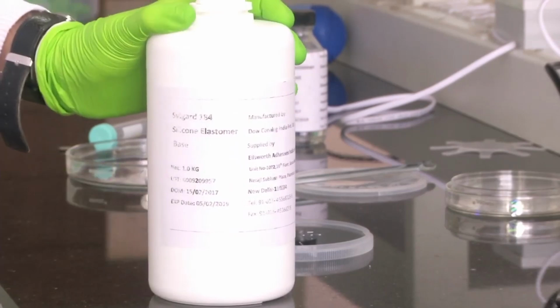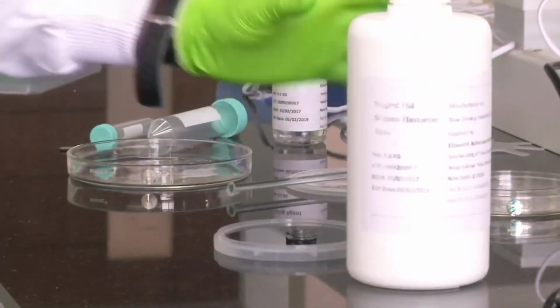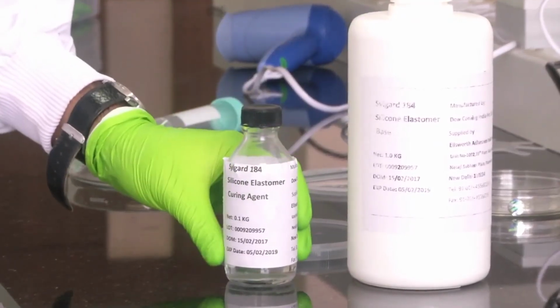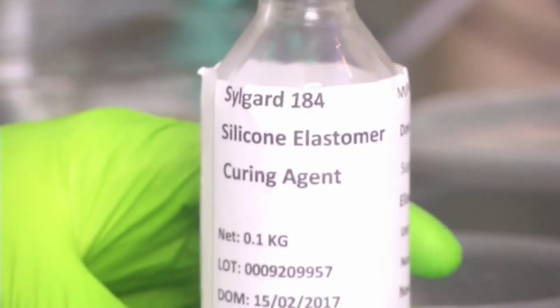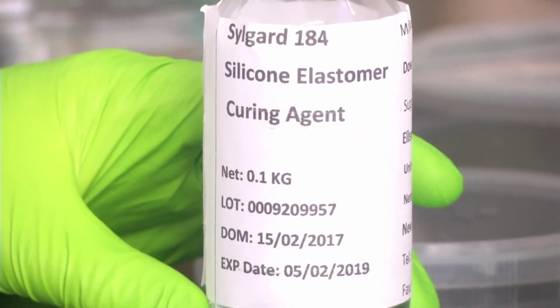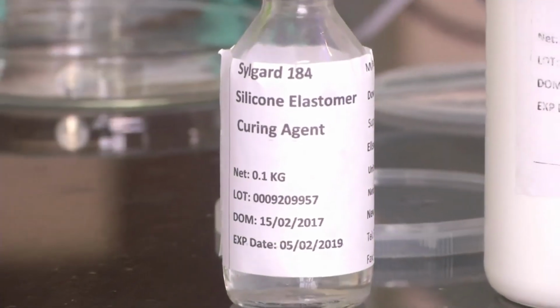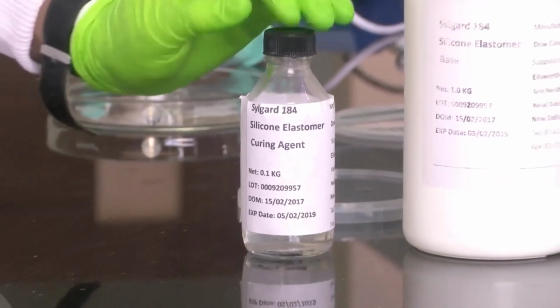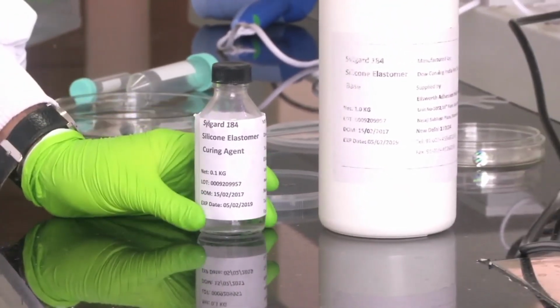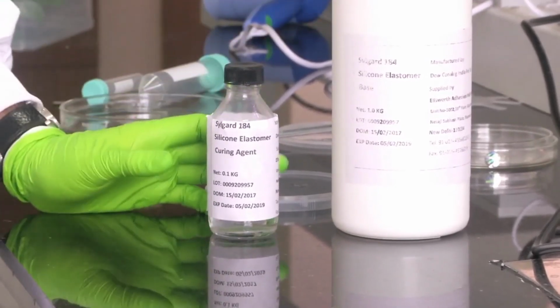It's a 1 kg bottle, we will use very less quantity of that, around 50 ml. Then this is the curing agent. So, this is another chemical. This curing agent is what will make the PDMS become solid after sufficient time. So, we have to mix PDMS and curing agent in 1:10 ratio. So, 1 part of curing agent and 10 parts of PDMS, that is the usual mixing ratio.